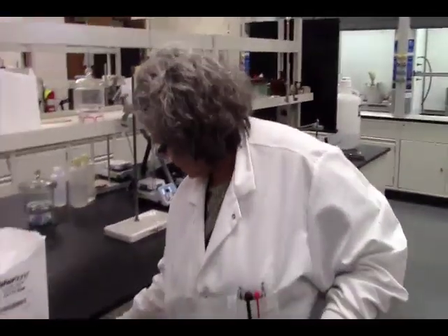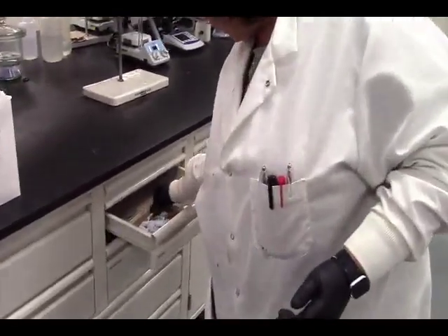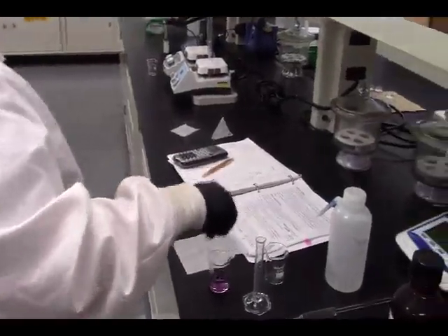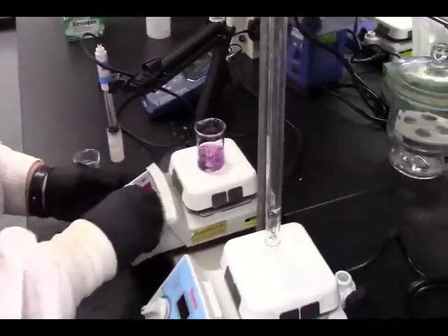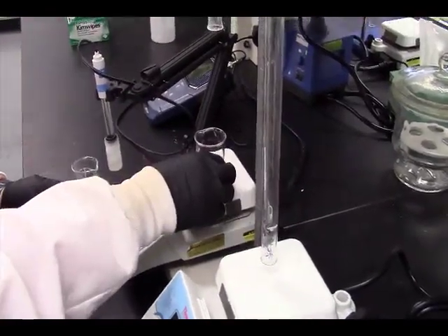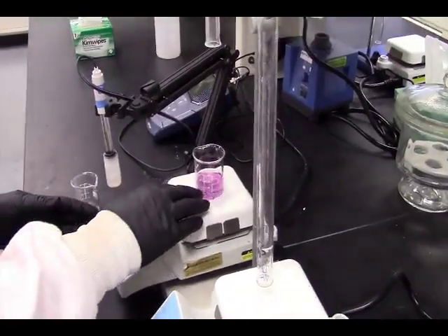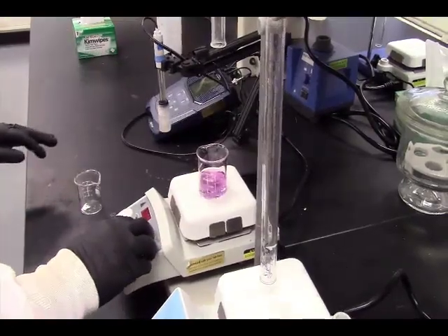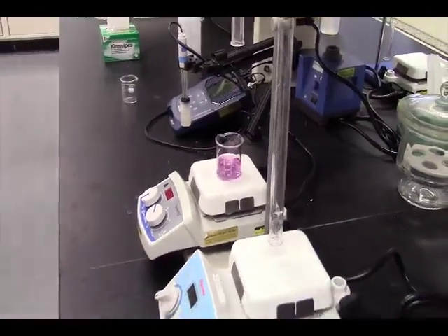So, where's me a little stir bar? Let's just gently stir that. And let's move on to the next complex.